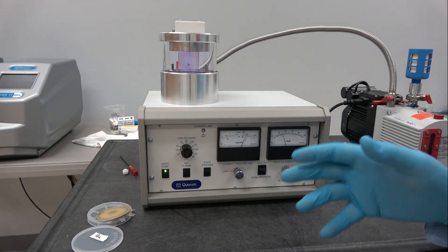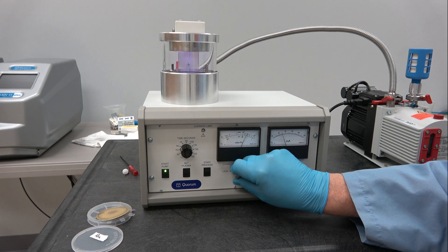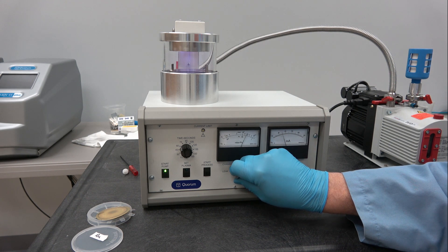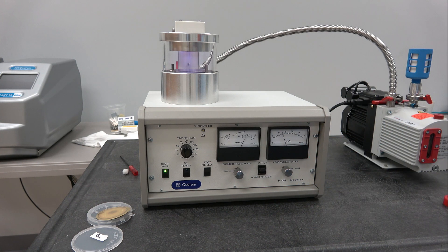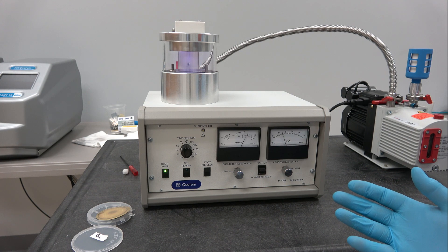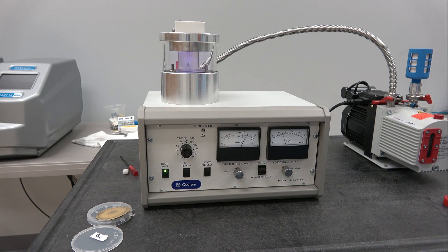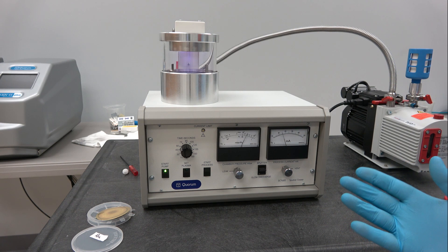This is not a press the button and walk away system. You might have to play with the valve here a little bit and adjust the current so it's constant. With this system being a very primitive coater, you will get some variability in your coating. This is just due to the nature of the system.